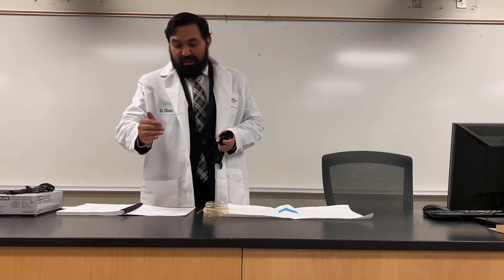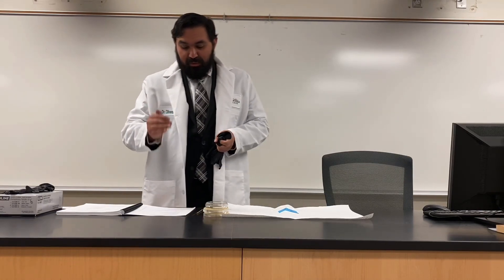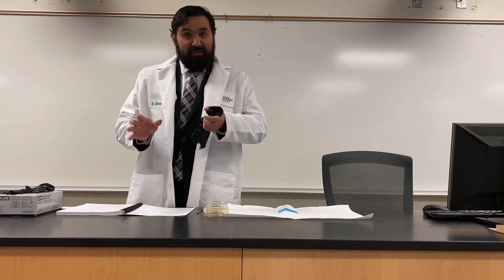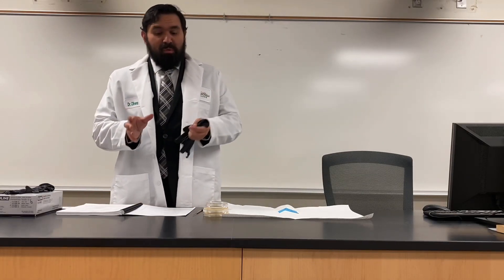What we want to do today is work on the rest of the selective and differential media type tests — labs 19 through 38. We're going to do about half of them first as we run through them, so let me give you an idea of what we want to do.